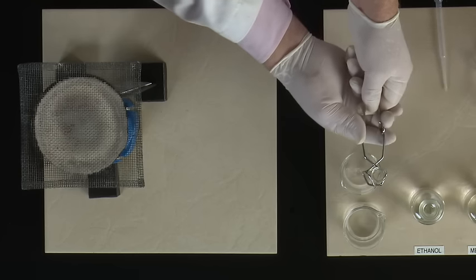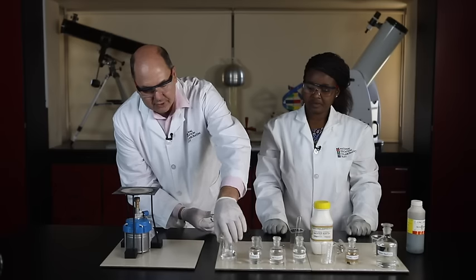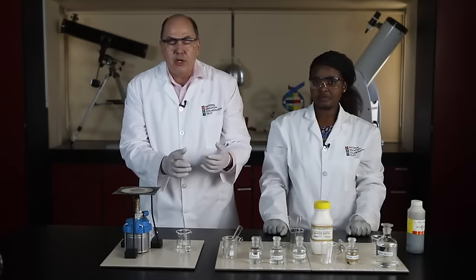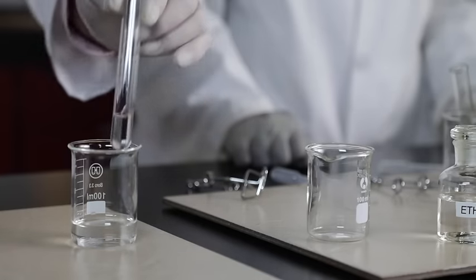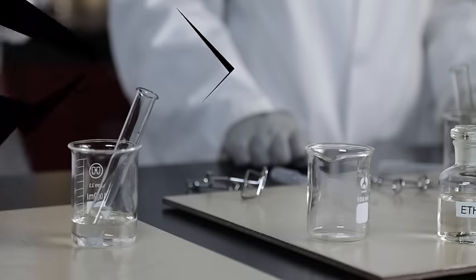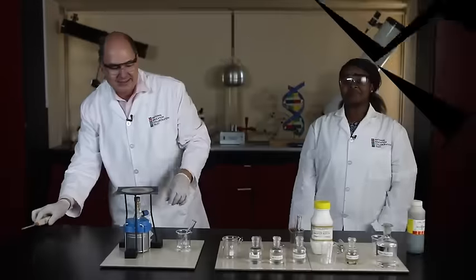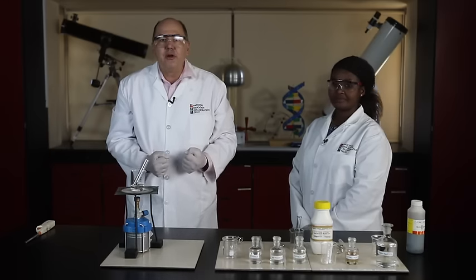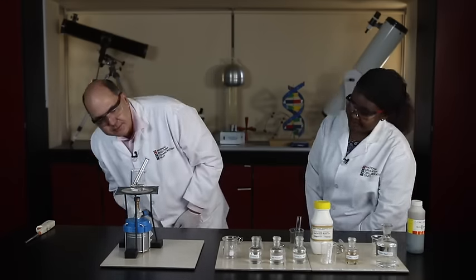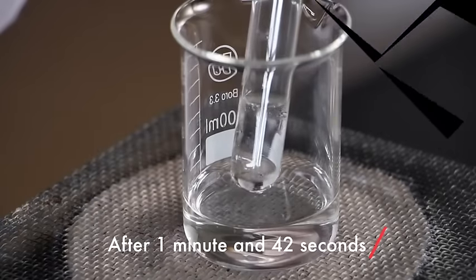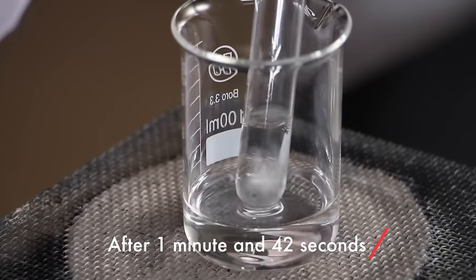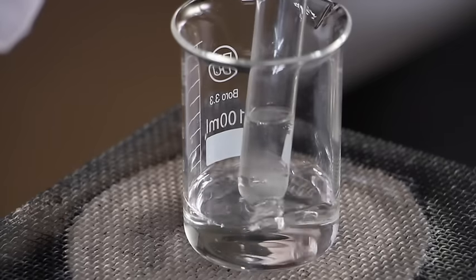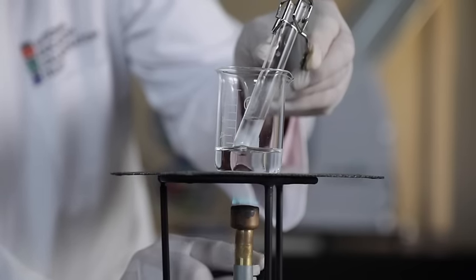I'm going to rest it in the test tube in this beaker over here for a moment while we get our water bath ready. So we've already added about 10ml of water into this beaker and we're going to now take our test tube with our reaction mixture and place it into that beaker. It's time to light the Bunsen burner and get the heat going. Now we put the beaker on the gauze mat and we heat the water until it boils. We're getting some bubbles inside the reaction vessel and the water looks like it's almost boiling. There we go, water's boiling. Turning off the Bunsen flame.